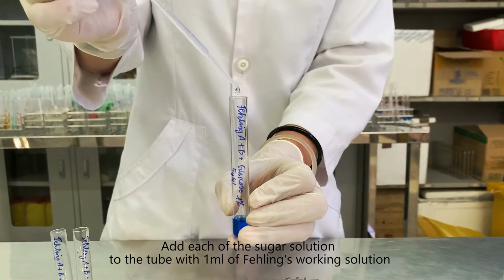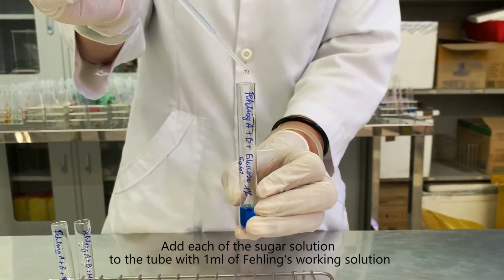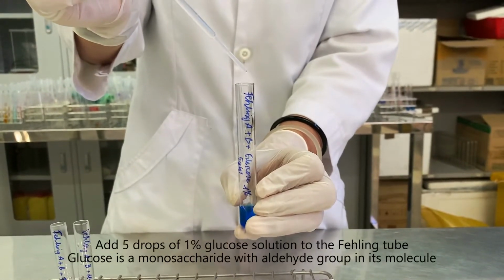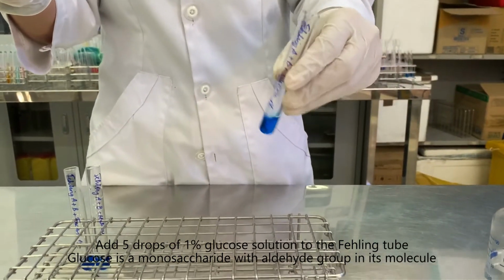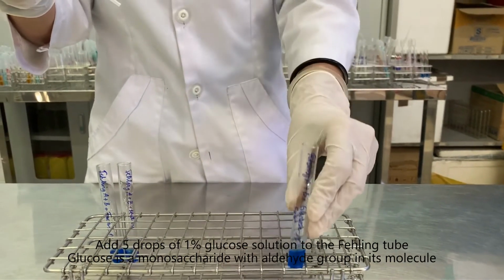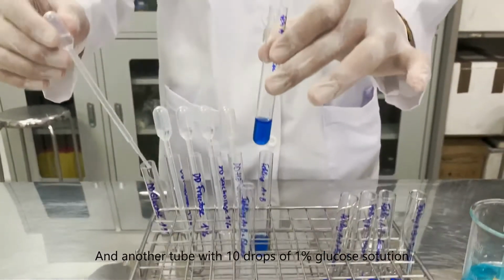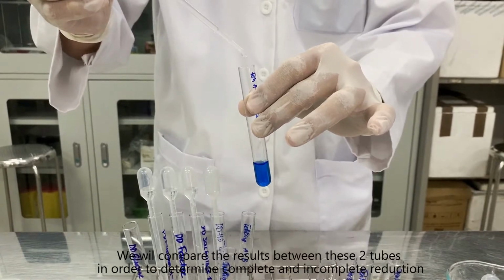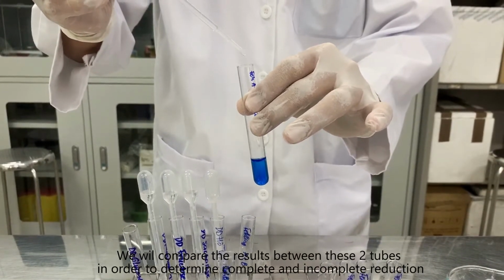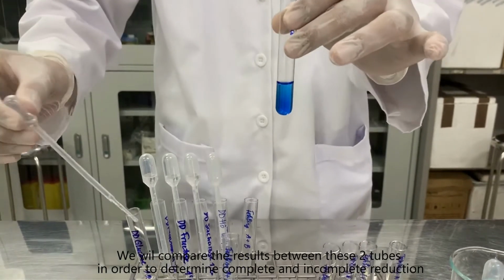Next, we add each of the sugar solutions to a tube with 1 milliliter of Fehling's working solution. Add 5 drops of 1% glucose solution to the Fehling tube. Glucose is a monosaccharide with an aldehyde group in its molecule. Add another tube with 10 drops of 1% glucose solution. We will compare the results between these two tubes in order to determine complete and incomplete reduction.